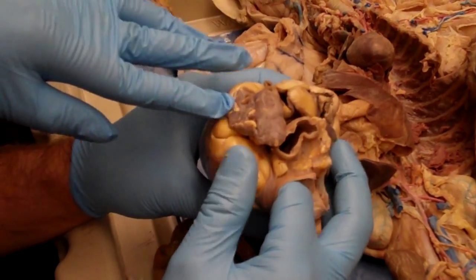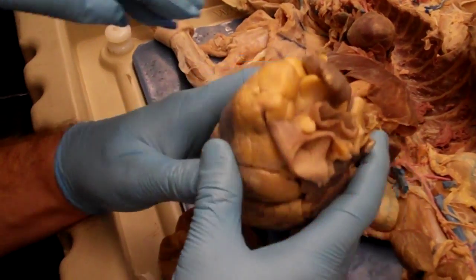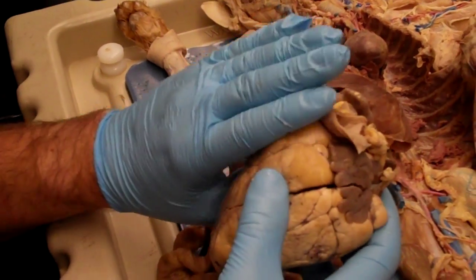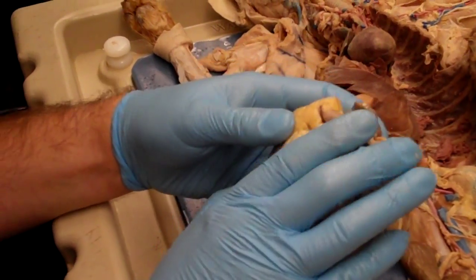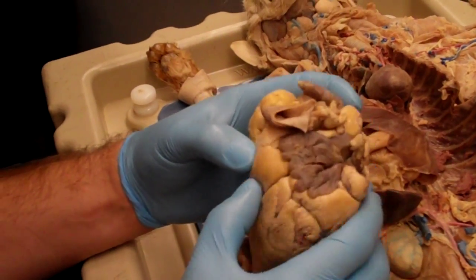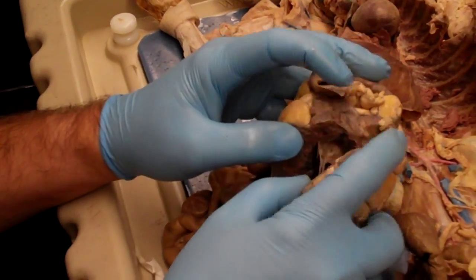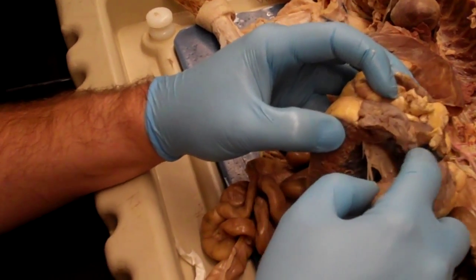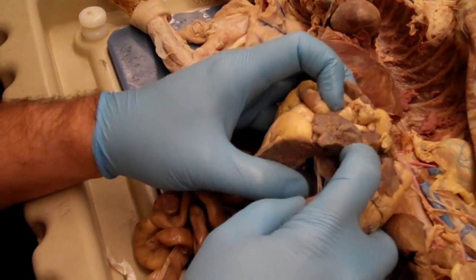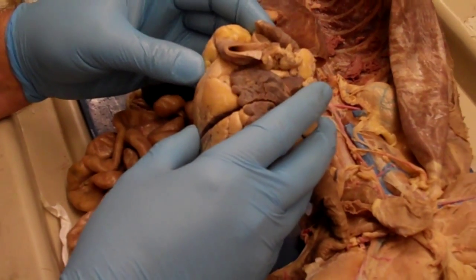And then which one is this one? Is the left? So this is going to be the right auricle, because this is the right heart. So yeah, this is going to be the right heart here, and this will be the left heart there, and so that'll be the left auricle. The other thing, if you're not sure, is you can open it up so we can see this auricle is opening up into this atrium. This atrium is opening up into the left ventricle, so we know that this whole system has to be the left side of the heart.